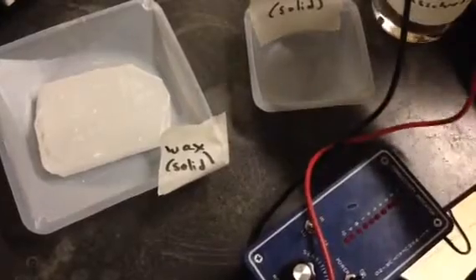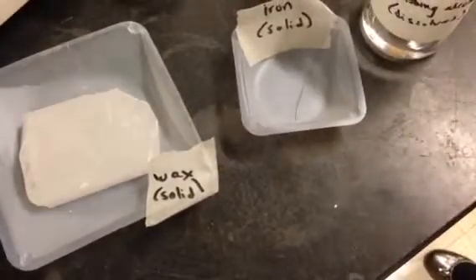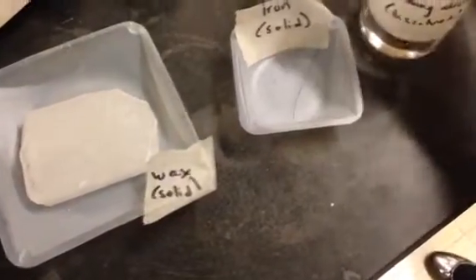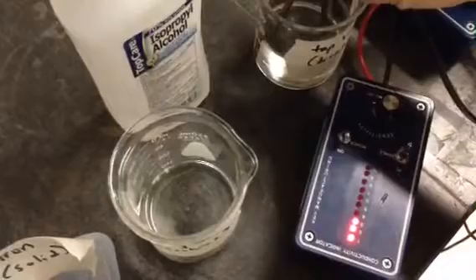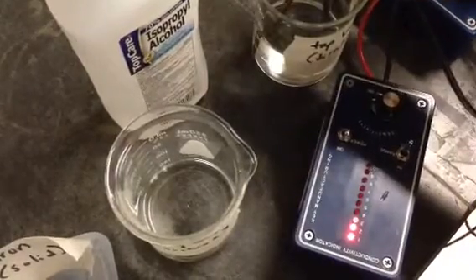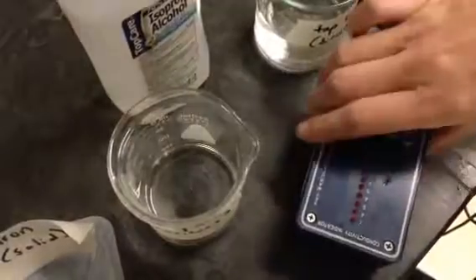Okay, so we've got rubbing alcohol. That is dissolved, and there are no lights lighting up. Whoops. We've got tap water. Ooh, so that is 3 lights lighting up for the tap water. So there is something dissolved in the tap water. It's your job to figure out what that is.